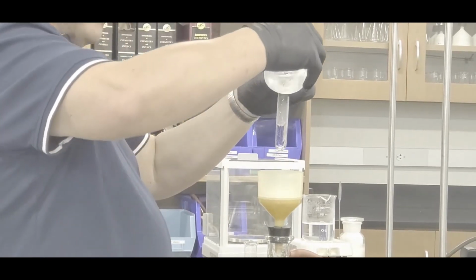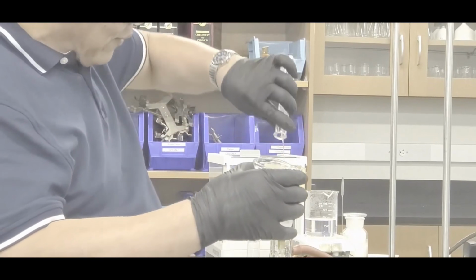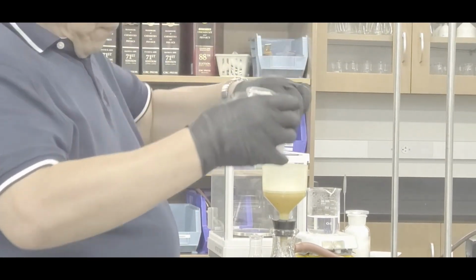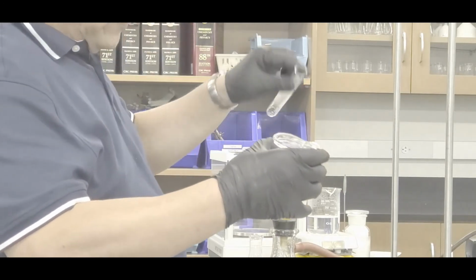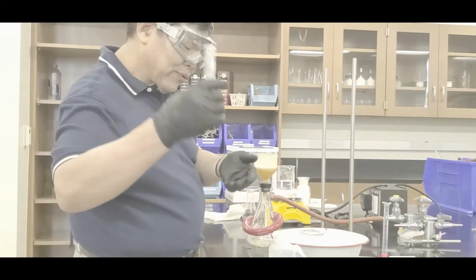See, basically what you're doing is you're taking the aspirin out, and you're also rinsing with distilled water to wash off a lot of the acetic acid. Ooh, yeah, one more time. All right, so in that case, I'll put that back over here. You're done with the test tube.